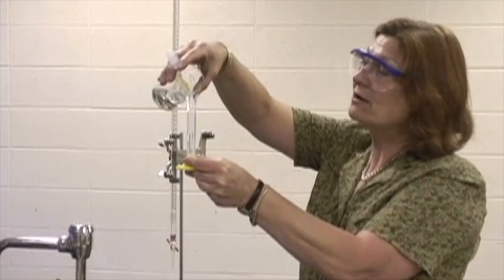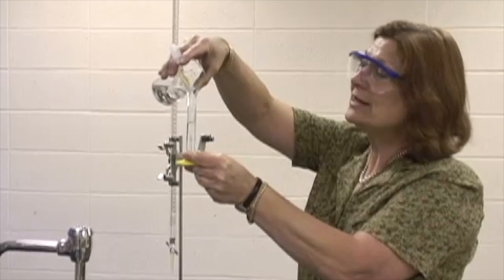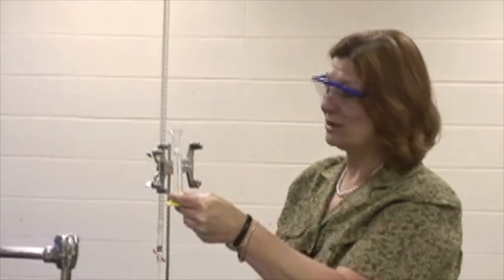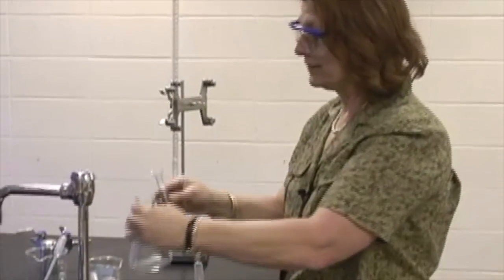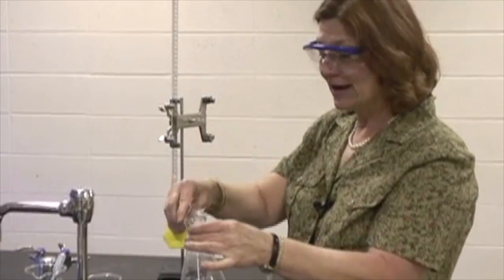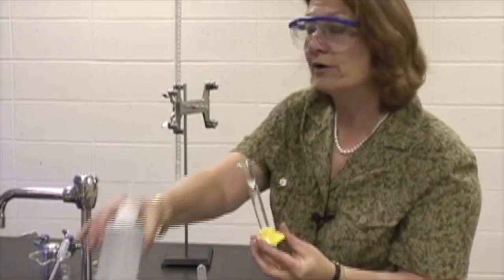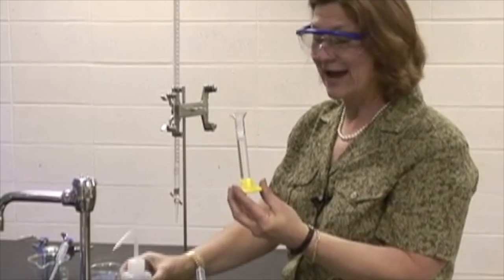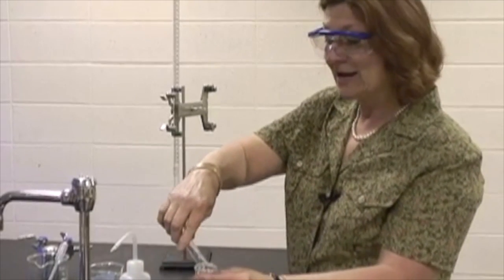Now, we could have some errors in our parallax of looking at the line, and I see that it's above the line. Sometimes professors don't like us to use these eyedroppers to get it exactly on the line, but I'm not returning the material back to my beaker, and I have 10 milliliters of my 0.1 molar acid. I will put that into my Erlenmeyer flask. Then I'm adding another 10 milliliters of water, and I'm also using it to rinse out the acid, to make sure that I'm getting all of the acid into my flask. Now, the amount of water is not critical because it does not change the number of moles.